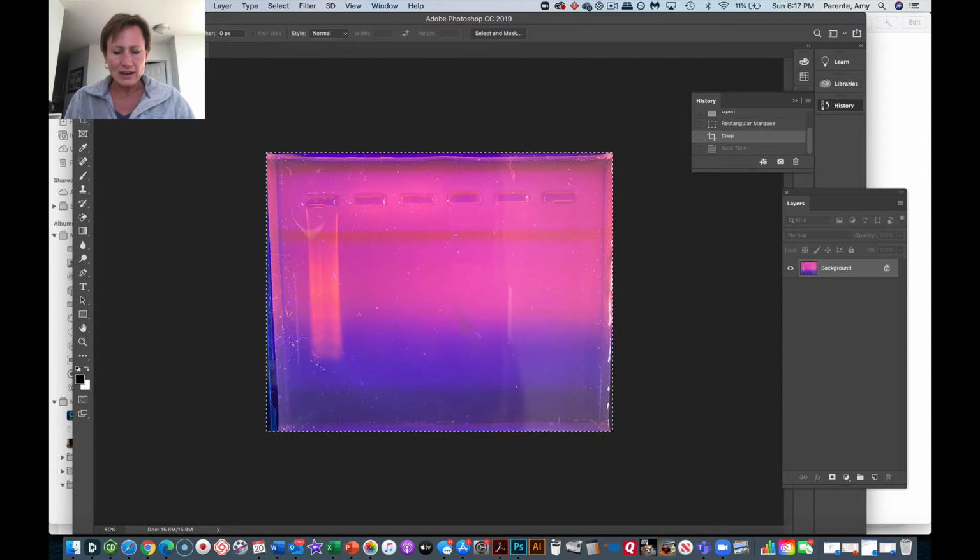And I'm going to toggle back and forth. Command Z is my favorite function. It undoes things. So I'm going to take a look here and see. I kind of like how it, well, let's see. Well, we'll leave it with that. So that sort of fixed the levels, that auto fixed the levels.